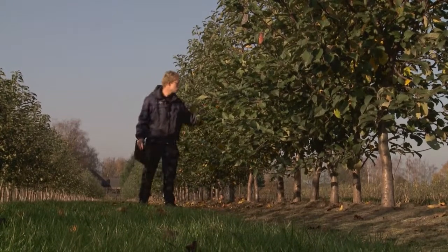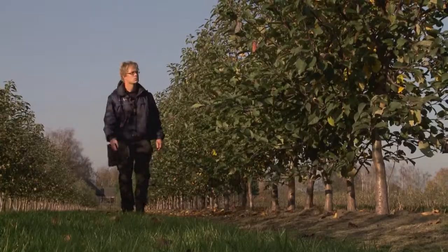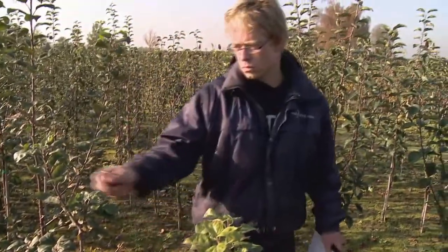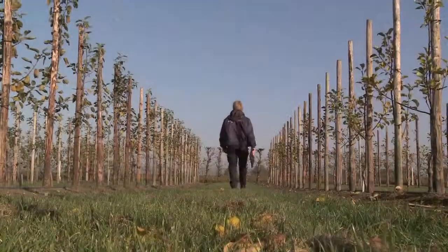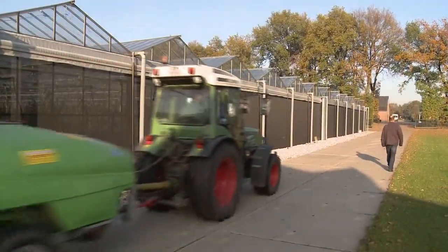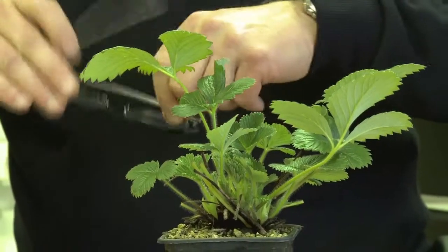Using various grafting methods, tissue of the plant to be tested is transferred to virus-sensitive indicator plants. The indicator plant is inspected for the presence of symptoms at various stages. For some pathogens, it can take several years before symptoms appear. Field testing is essential to detect viruses such as rubbery wood in apple and pear.